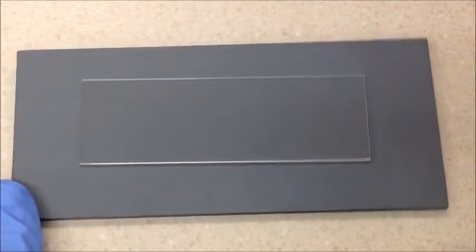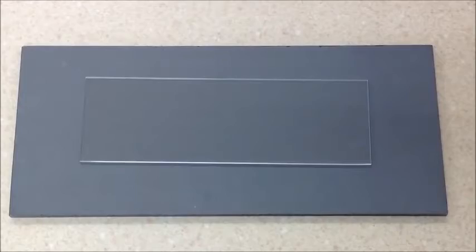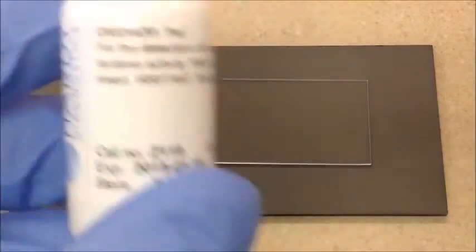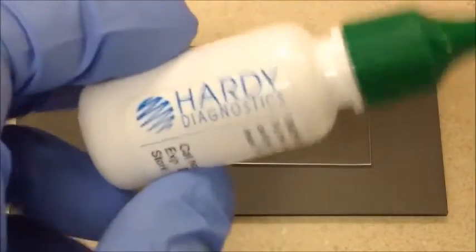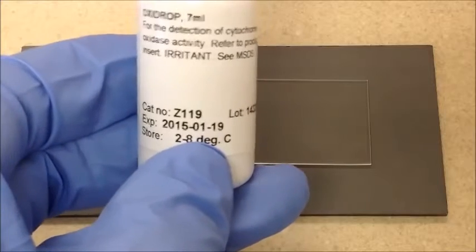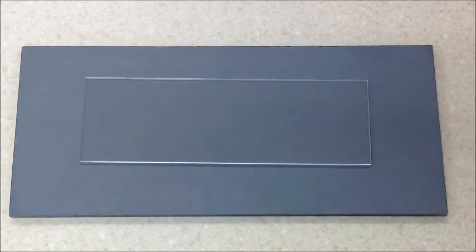In this video we're going to be doing the oxidase test using Hardy Diagnostics OxyDrop reagent. The oxidase test is mainly used for separating members of Enterobacteriaceae from non-Enterobacteriaceae, mainly Pseudomonas. These are gram-negative rods.